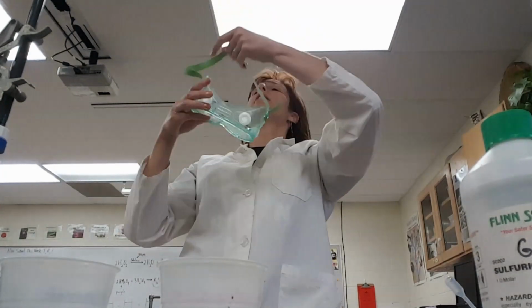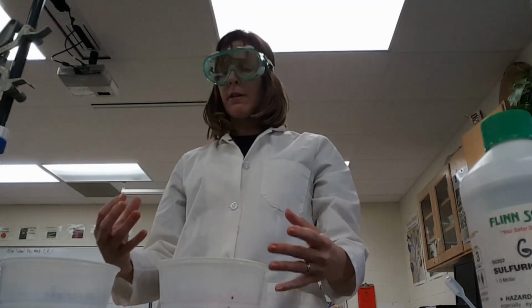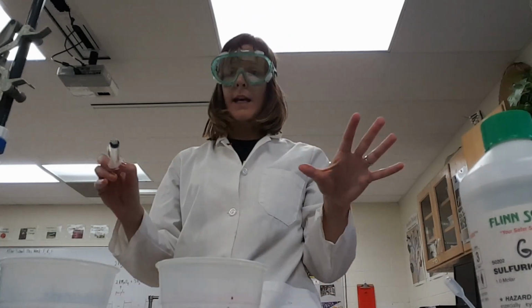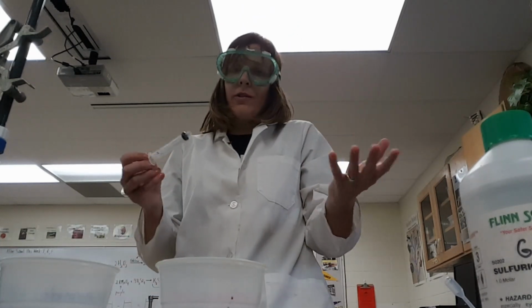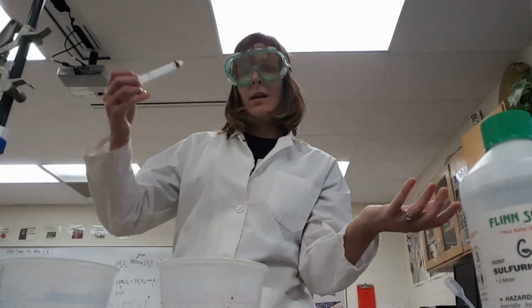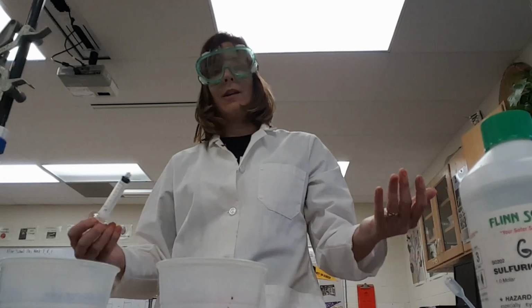Okay, so here's how you're going to do your basic titration. All right, so we're going to start out with putting on our goggles. Definitely have to wear eye protection. All right, and we're going to find out how much hydrogen peroxide there is in the hydrogen peroxide solution to begin with, okay, without the enzyme present at all. So in order to know how much was broken down, you have to know how much you started with, and then you'll have to also know how much you ended with and figure out from subtraction then, therefore, how much was broken down.